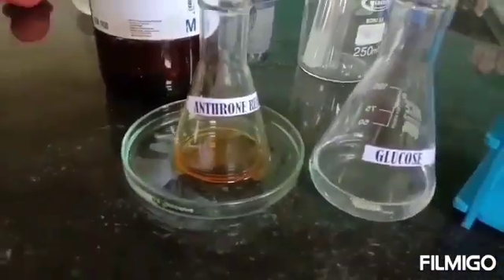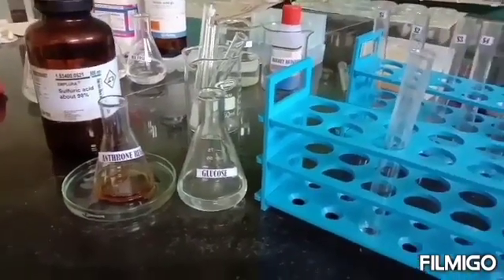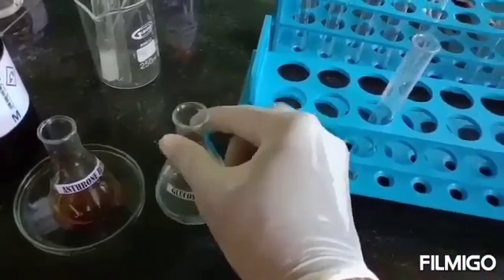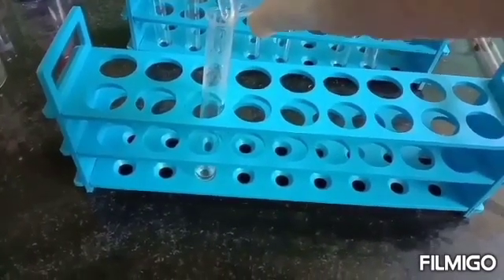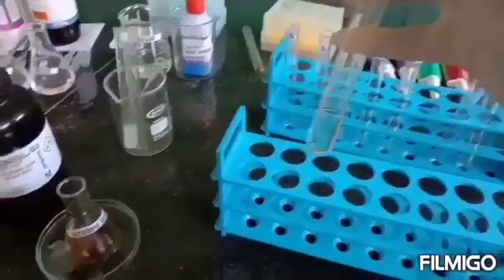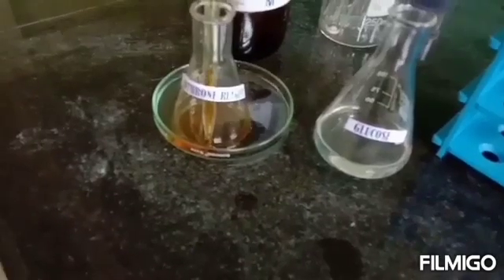The carbohydrate used here is a 1% solution of glucose. To start with, we add approximately 2 ml of 1% glucose solution to a clean test tube. This is a qualitative test, so approximate addition only.